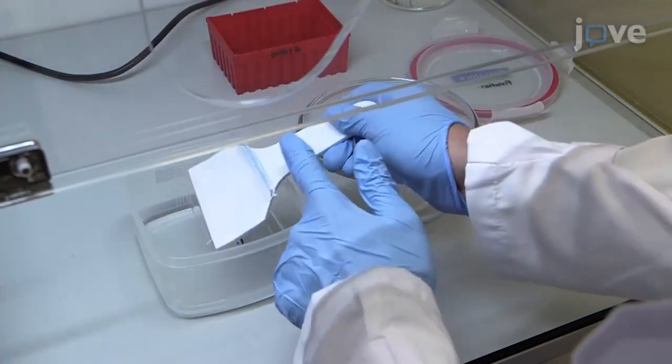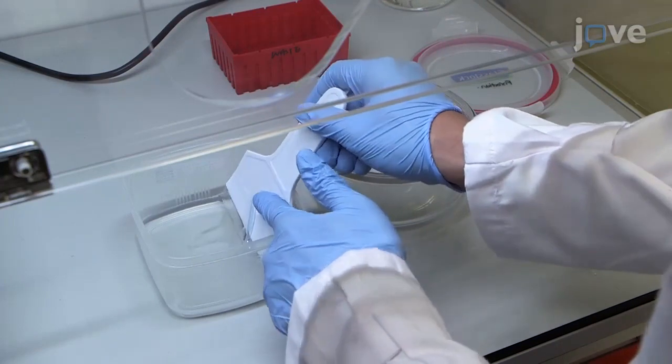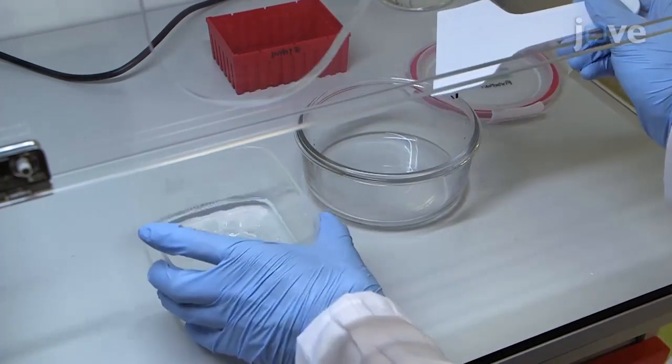Next, wash the gel three times with ultrapure water in a clean container with each wash lasting 10 minutes.